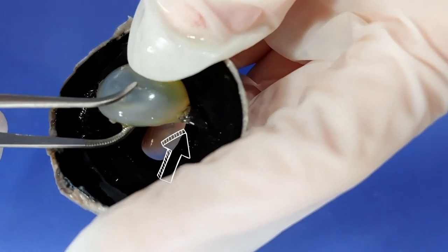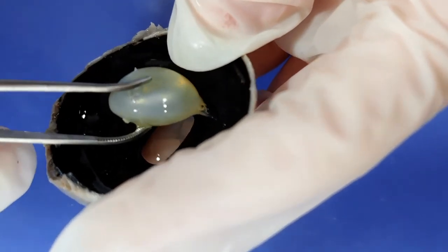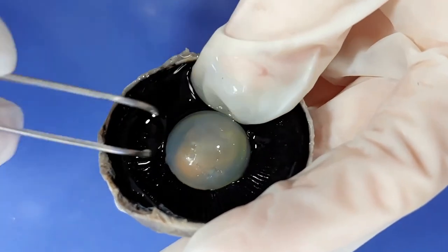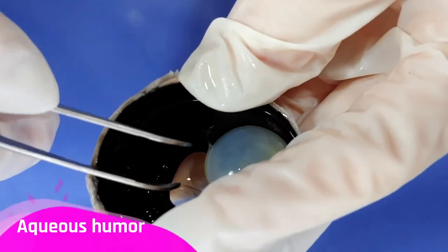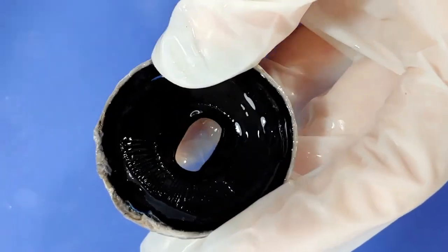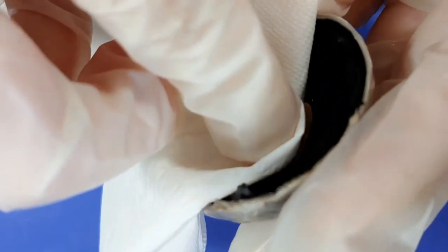So now you can see more liquid coming out. This is called the aqueous humor, and it's in the space between the lens and the cornea. So now I'm just going to drain this liquid and pat it dry.